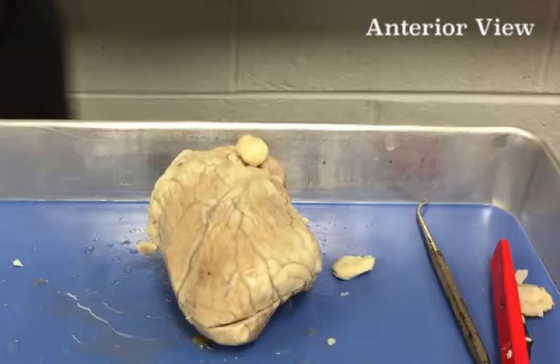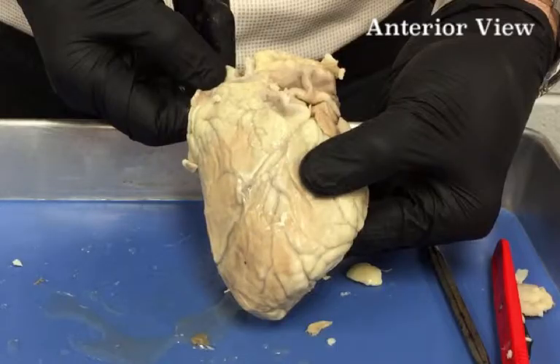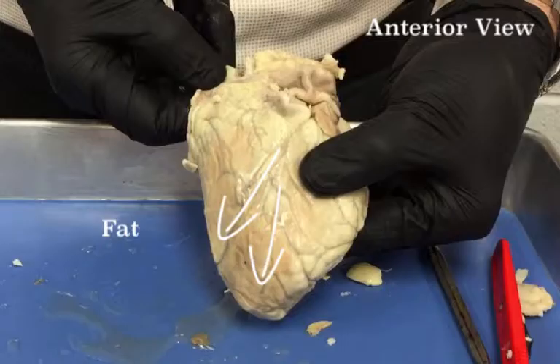Some sheep heart specimens will still have the pericardial sac attached. The one I have here does not. Locate the visceral pericardium, which appears as a thin, transparent layer on the surface of the heart. Also, note the abundance of fat along the paths of various blood vessels. This adipose tissue occurs in the loose connective tissue that underlies the visceral pericardium.